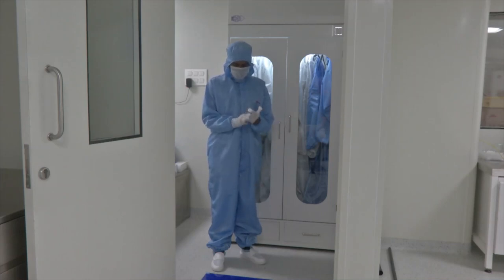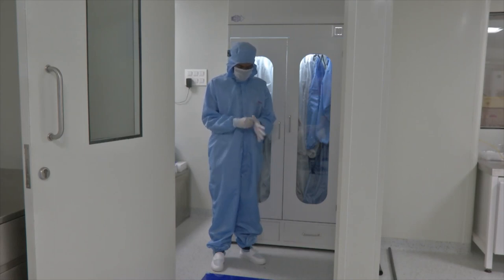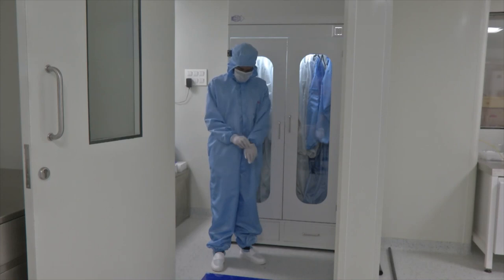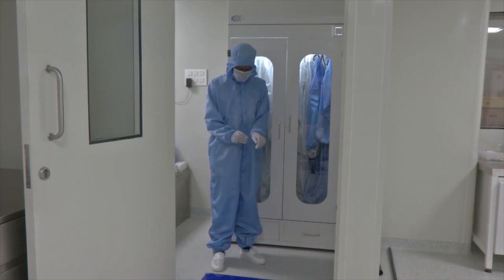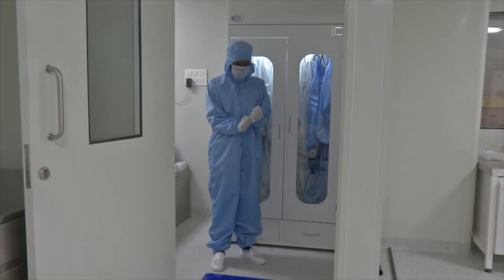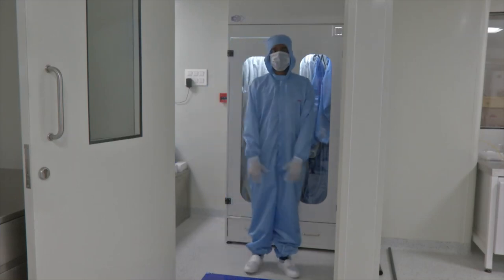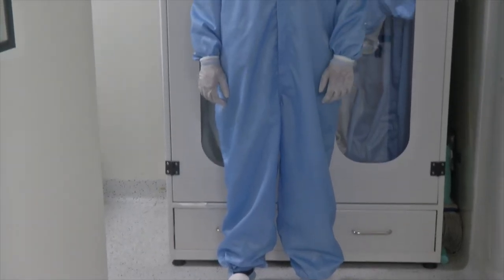So, till now we have seen how to wear a clean room gown and the different parts required to cover maximum body parts exposed. This entire process is required to reduce the number of dust particles generated as you enter the clean room.